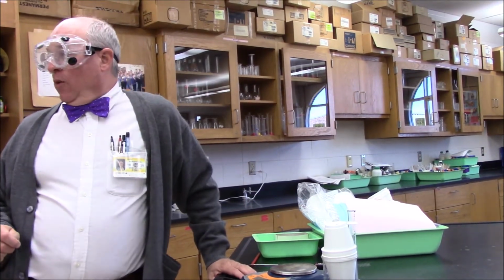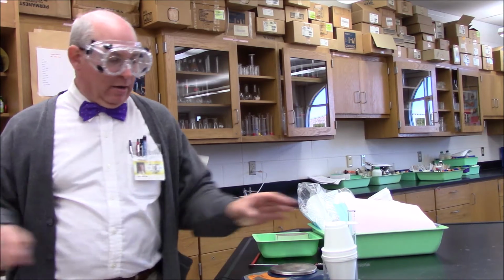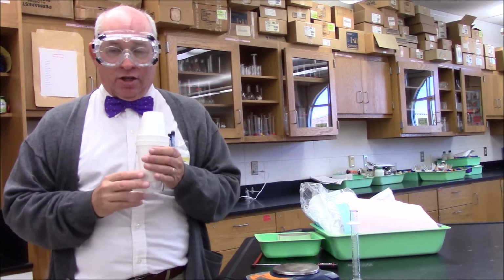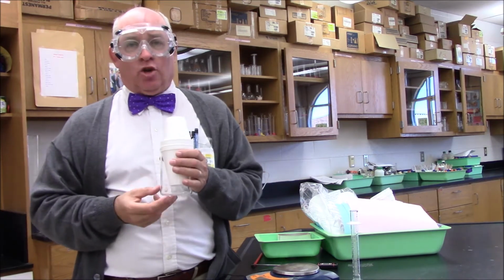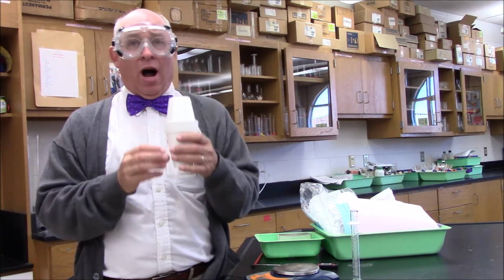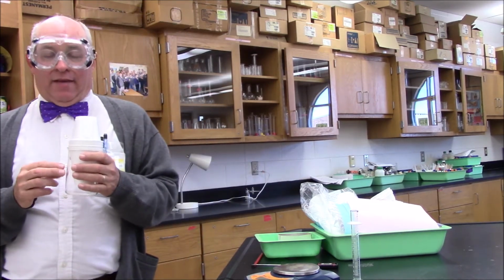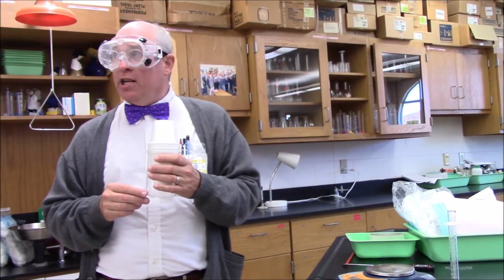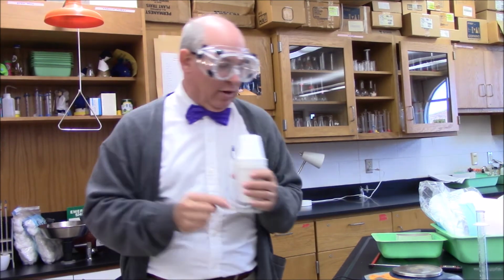What we're going to do now is move the zinc metal into the calorimeter. The metal will undergo an exothermic process, releasing heat, which will be absorbed by the water. So for the water, this will be endothermic. Then we'll do a little bit with the law of conservation of energy and our heat capacity equation and see how well we can do calculating it.